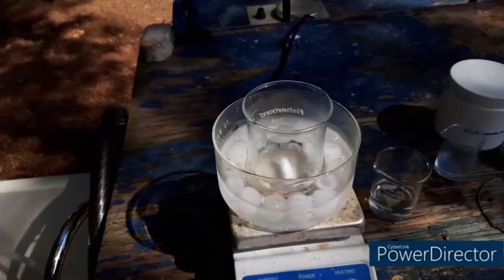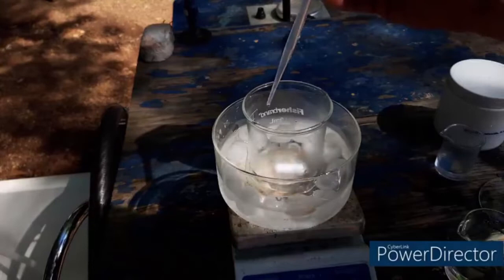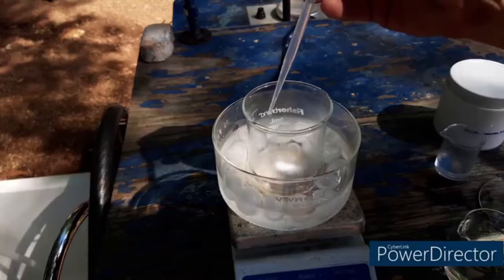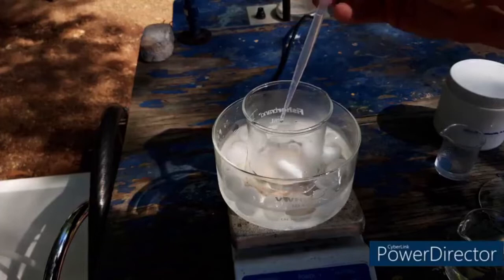Here we go with our potassium molybdate. We are getting little bits of molybdenum trioxide but it goes back into solution. Is it going into solution or is it just mixing it up really well and dispersing it? I think it is the latter.